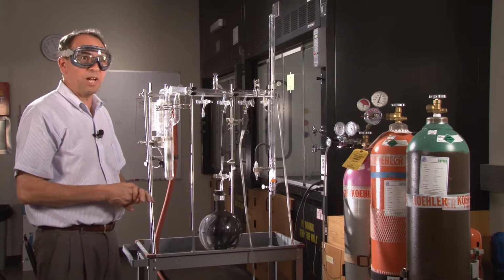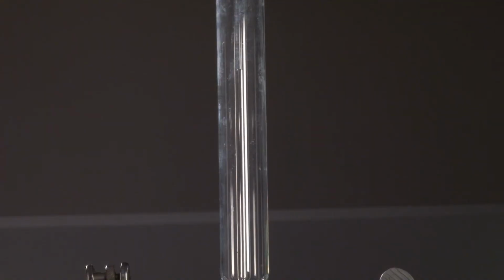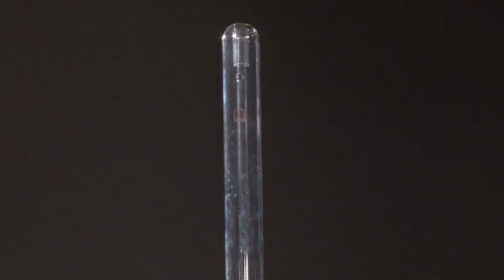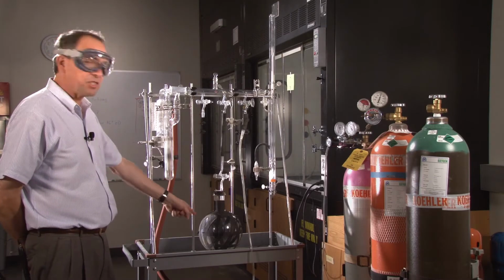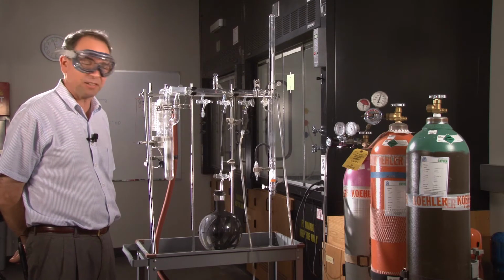Now it's going to take a little while for this to completely evacuate. You can tell when it starts getting to the vacuum, when it starts going back to the noise that it was before. So it's still got quite a bit in there. One of the things about it is this takes a long time because this is 5 liters. So that's a big volume for the vacuum pump to handle.